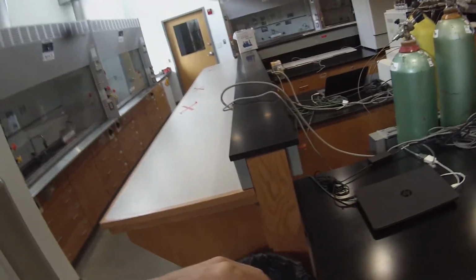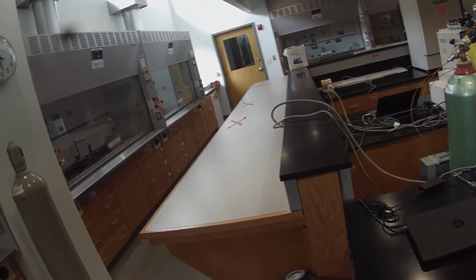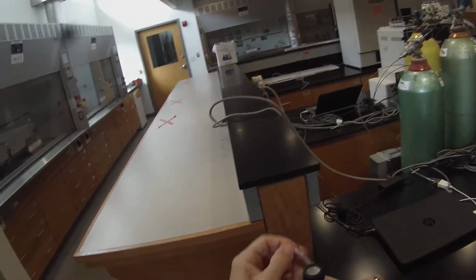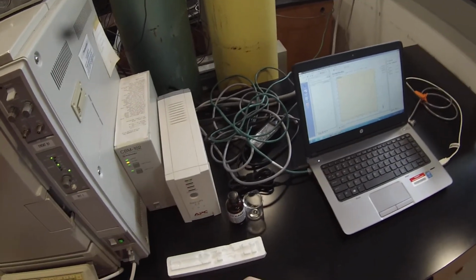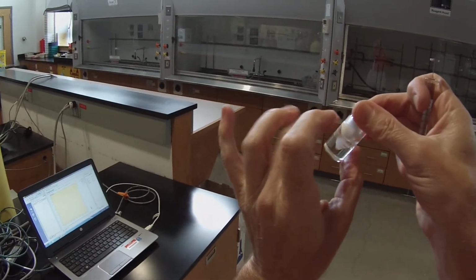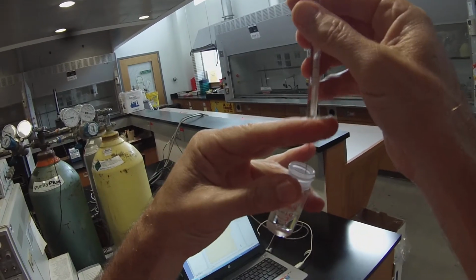So I can take the parafilm off my vial. Remember, this was the one that I spilled most of, so there's not much sample. You have to be a little careful. And the septum loves to turn itself over when you uncap it. So I want to reach my syringe into just the liquid part and make sure I don't get any of the solid. I'm going to kind of guide the needle with those 2 fingers.